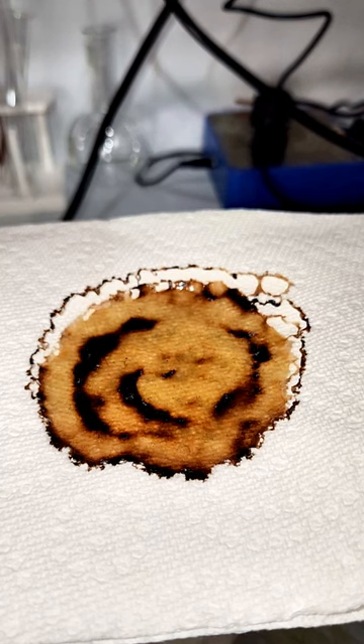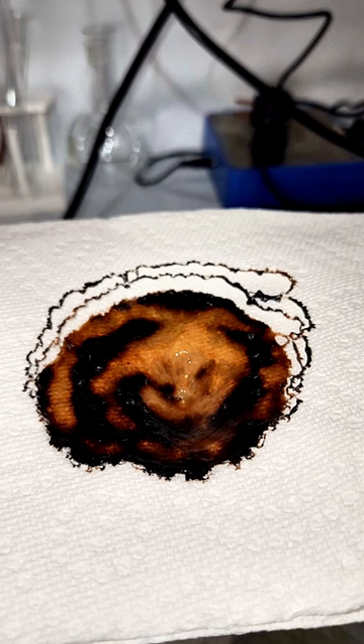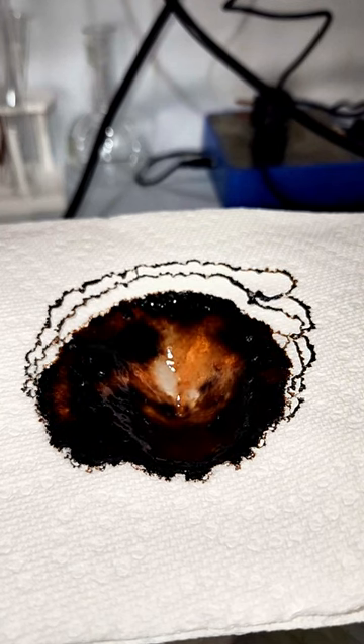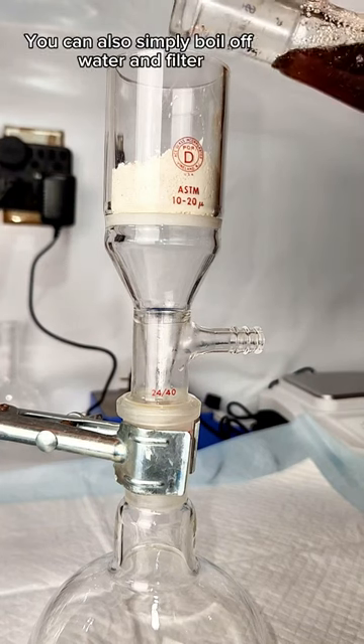My distilled sulfuric acid not only dissolves the paper a lot faster, taking only 21 seconds, but it also looks a lot different as it dissolves through the paper. Specifically, it turns a lot blacker, and it also produces these very clean lines, which I find interesting.